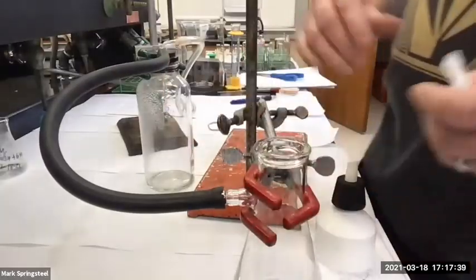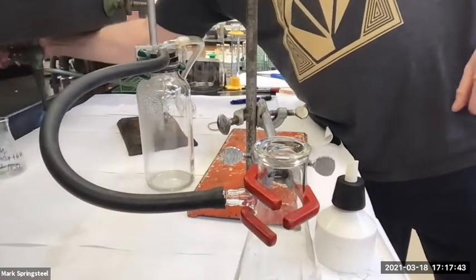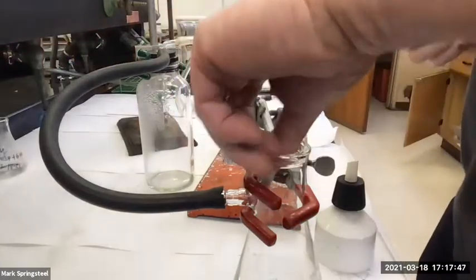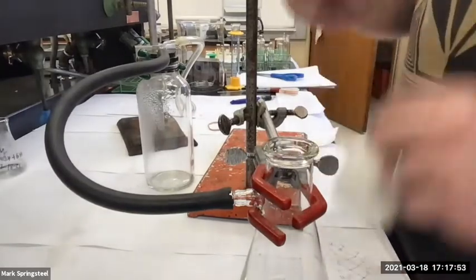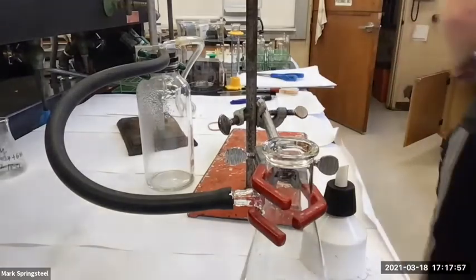Fun, huh? So is there a parafilm equivalent that you can use for organic solvents in the lab? Usually what you'll do is you'll take a cork, like a tree cork, or a rubber stopper that's really resistant to chemicals, but I think cork's the best. Normally you would use a cork, and that doesn't dissolve in the organic solvent.